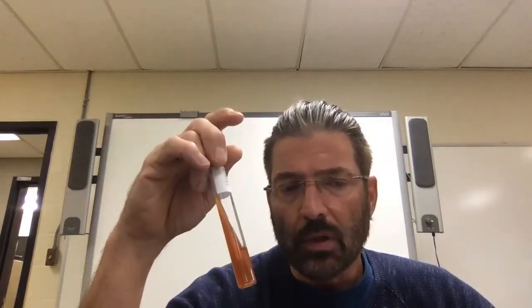Remember, bacteria will consume glucose first, lactose secondly, and protein last. It's really not their preference, but if they run out of food, for reproduction, they're going to consume protein. Bacteria will grow fastest on the slant as opposed to the butt. We didn't really poke these into the deep part of the butt of the tube. And just remember, if you go deeper in the tube, there's going to be much less oxygen.